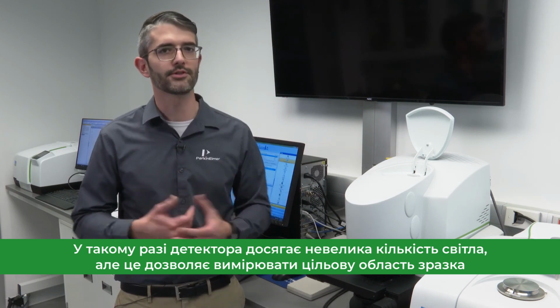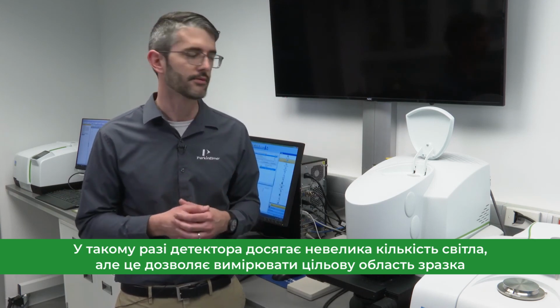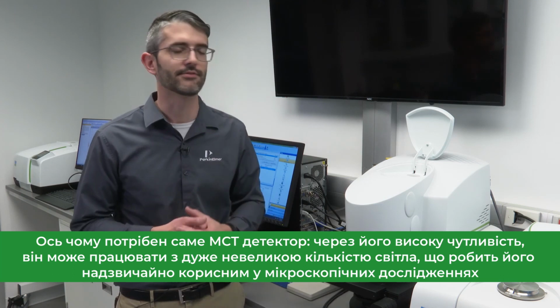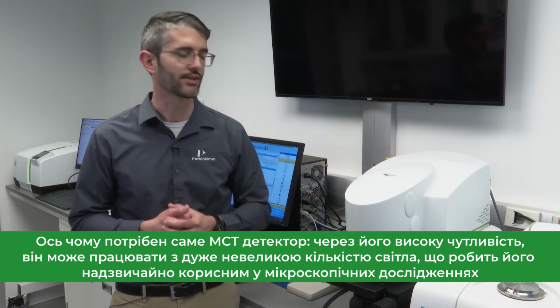It's important that the apertures are there to allow measurement of a targeted region of the sample, but then the MCT detector is required for its high sensitivity. It can work with very small amounts of light, which makes it extremely helpful in microscopic measurements.